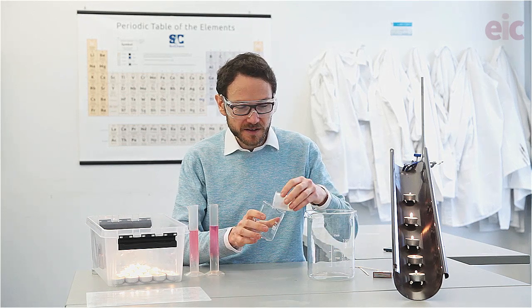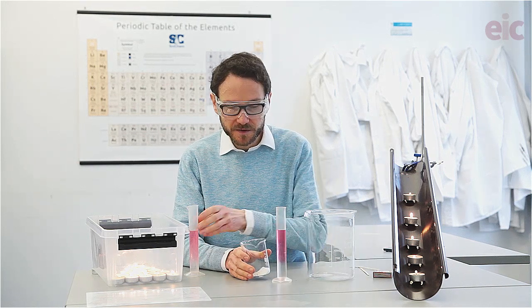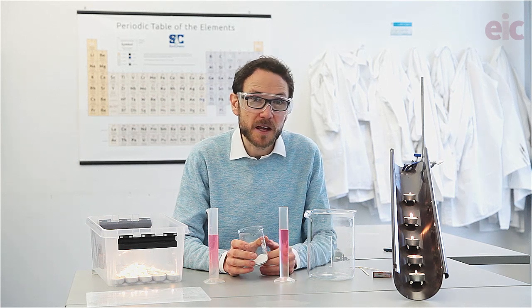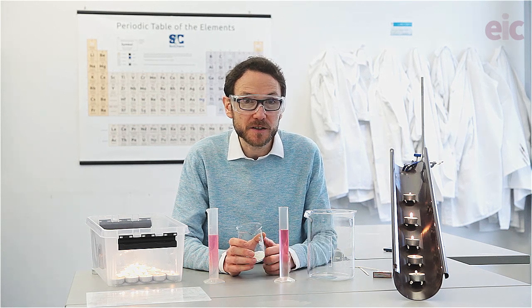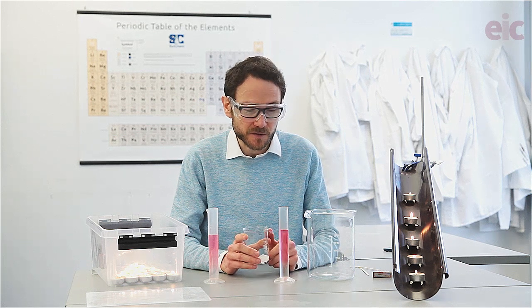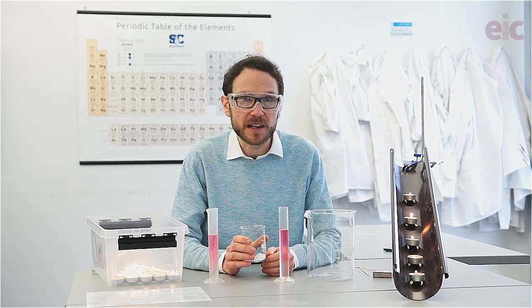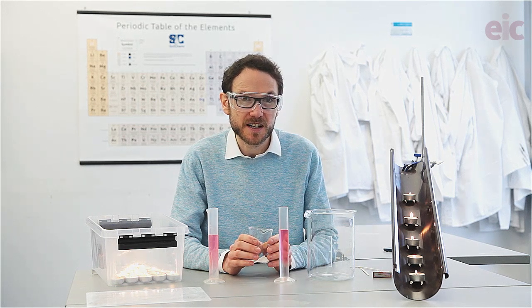So, 10 grams of calcium carbonate, and what I have here is two portions of 2 molar HCl. I've put some indicator in here, which helps it show up on camera — and it might be useful if you're doing something with your students around evidence of chemical changes, but of course it's absolutely not a requirement. The reason I've split the acid into two portions is that if you pour the whole lot in at once, the powder reacts a little bit quickly and will spill out into the larger beaker. Two portions will allow this reaction to go at a sensible pace.